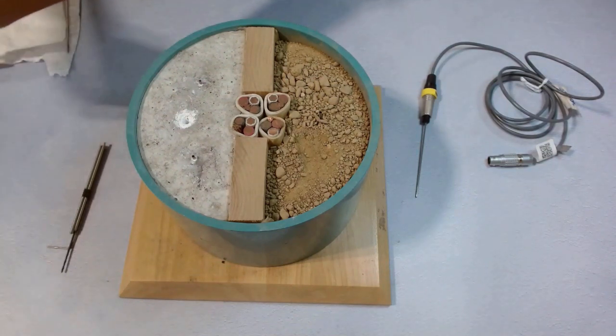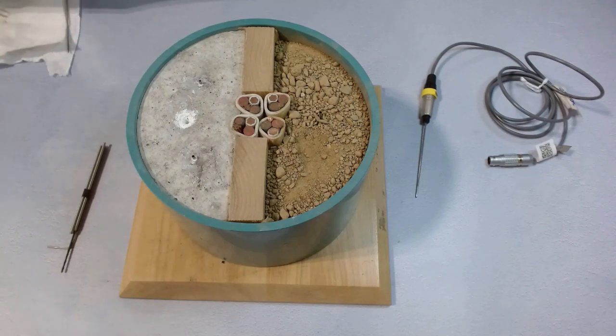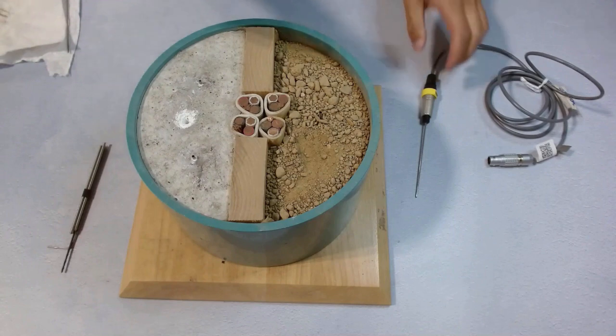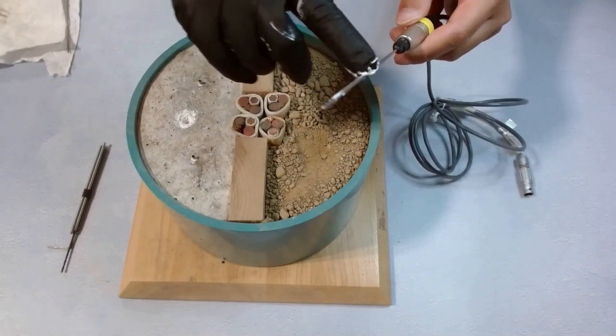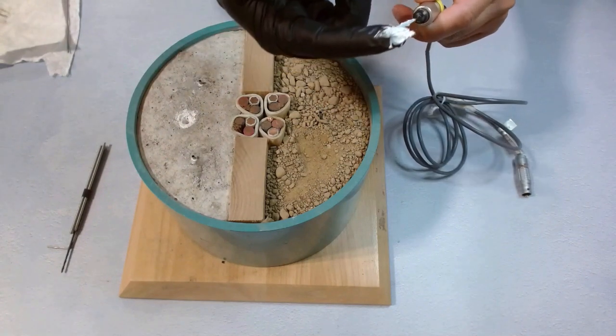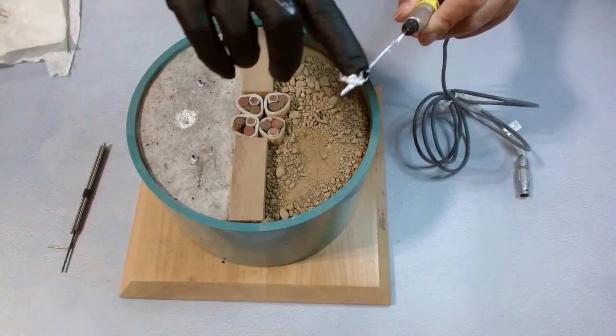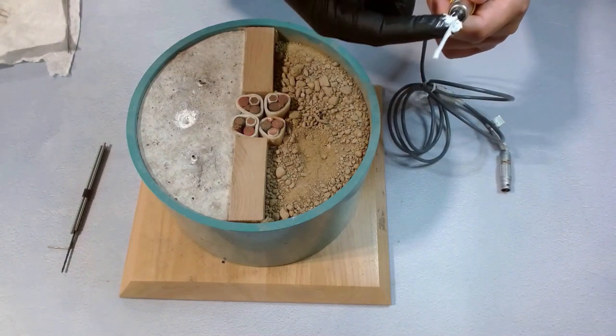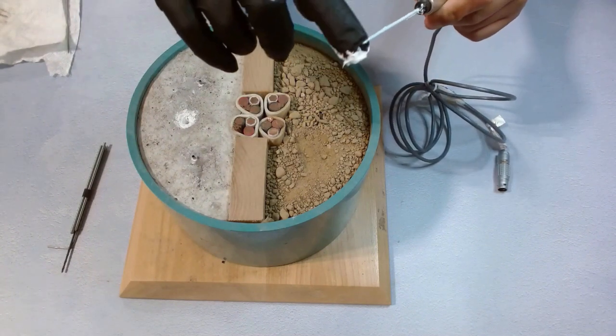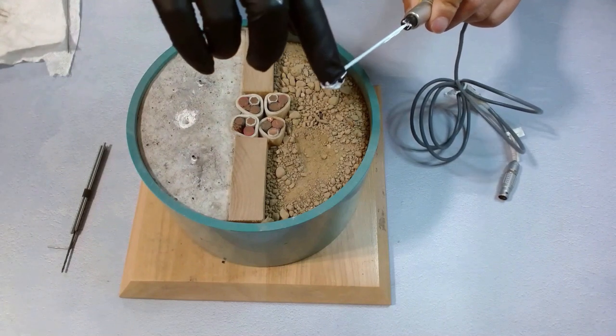We put on gloves and take some thermal paste. Grab the needle by the handle and apply gently along the needle tube. Make sure it covers the needle tube completely and smoothly, leaving no shiny metal part.